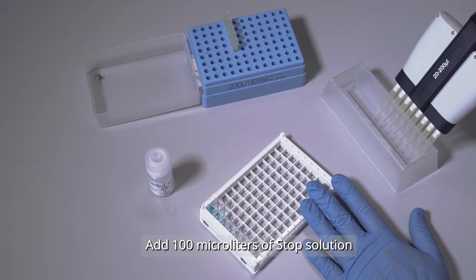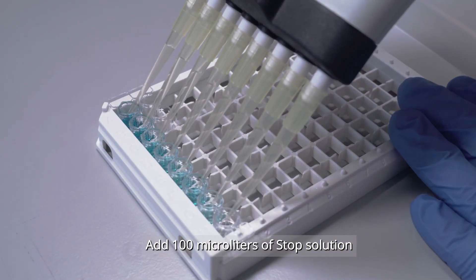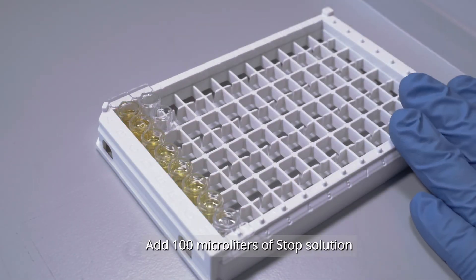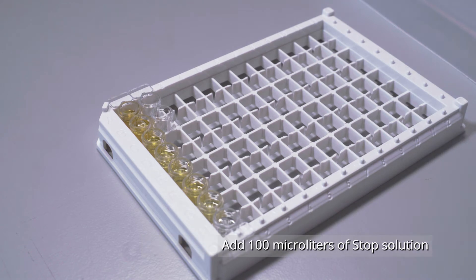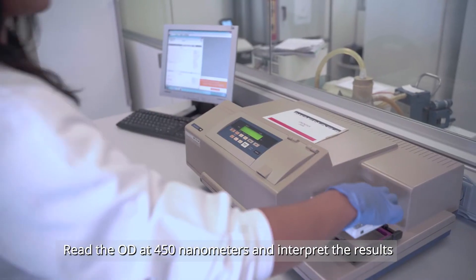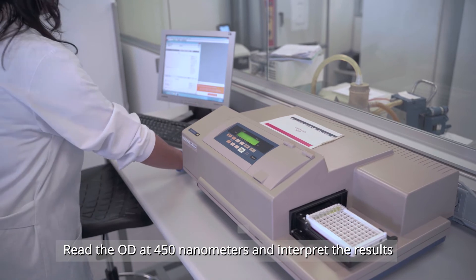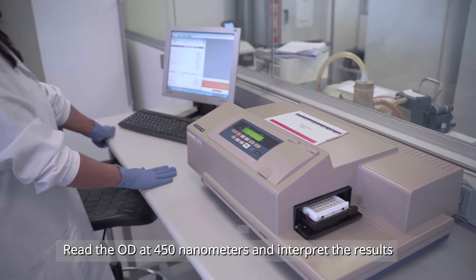After that, stop the reaction by adding 100 microliters of stop solution. Read the optical density at 450 nanometers and analyze the data to obtain a quantitative result.